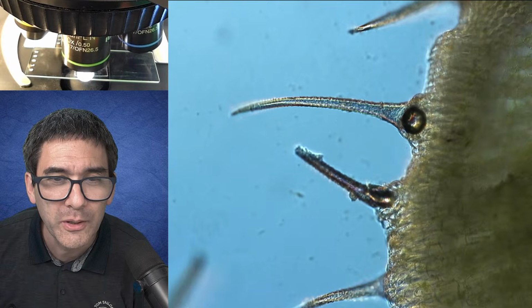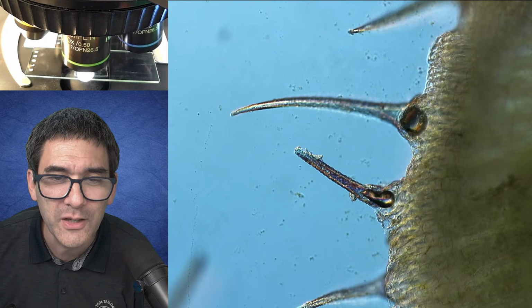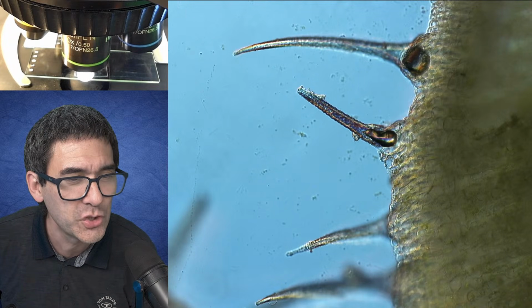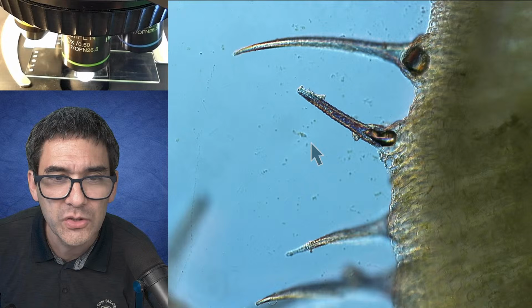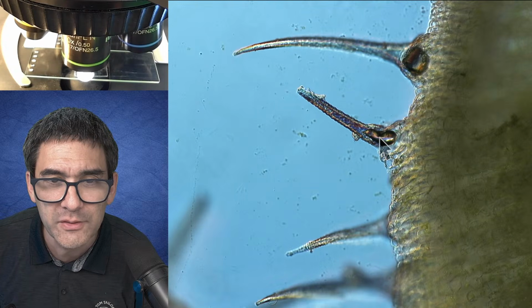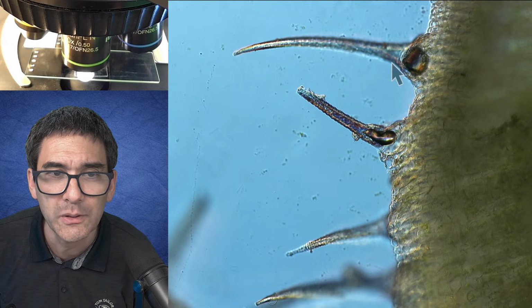Yep. Here we go. But maybe look, do you actually see this here? There is indeed, this might actually show that it's a hollow. Let me turn on the arrow again. Usually that's the reason why air bubbles sometimes are kind of useful, because this air bubble over here means that probably this spine, this spike, is a little bit hollow, right? Also over here is an air bubble.